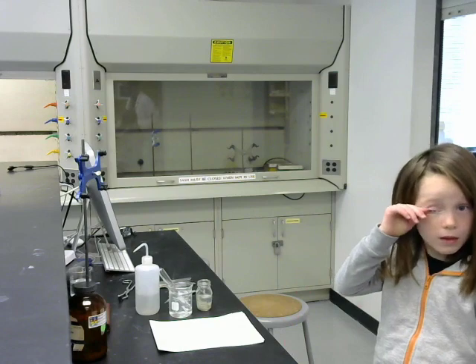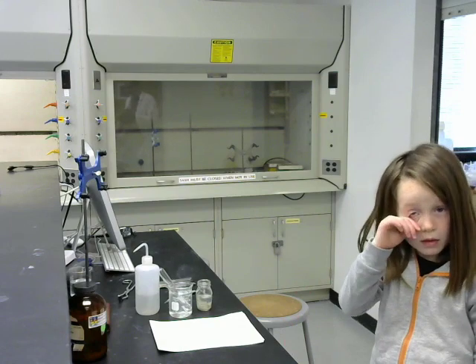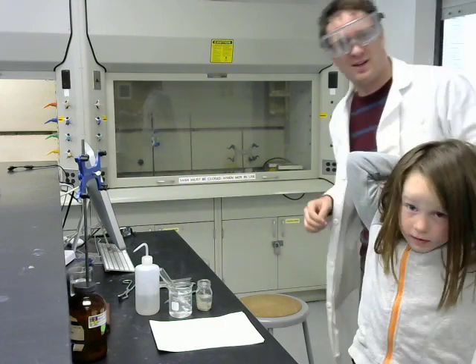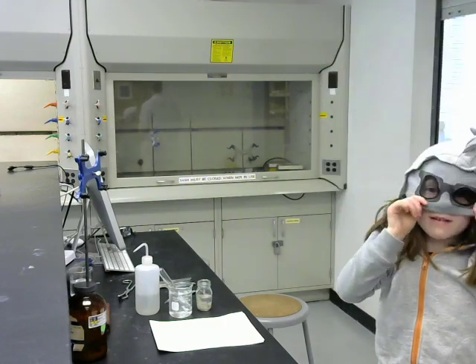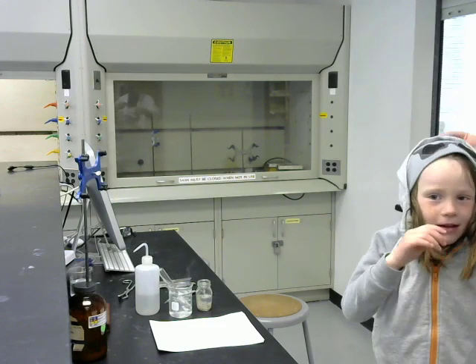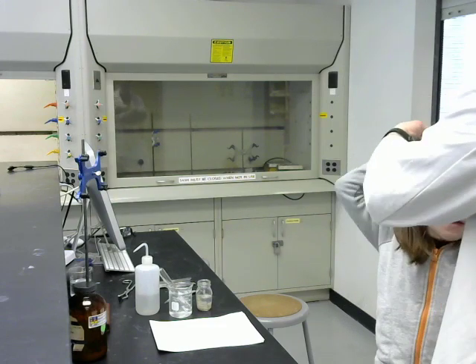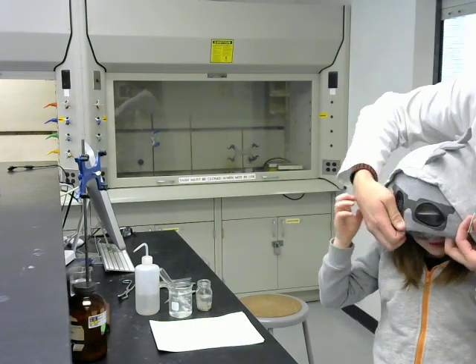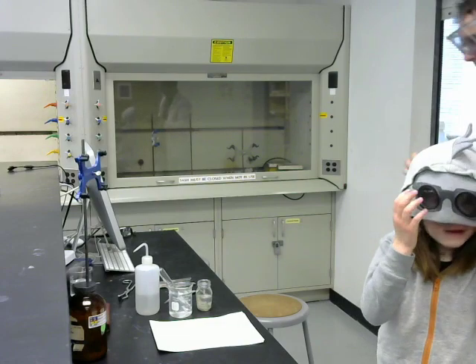Excuse me. I forgot my goggles, and Tina's got goggles too. Can you put your goggles on, hon? Oh, let's do real goggles first. Okay, but my sunglasses won't go, just like so. All right.